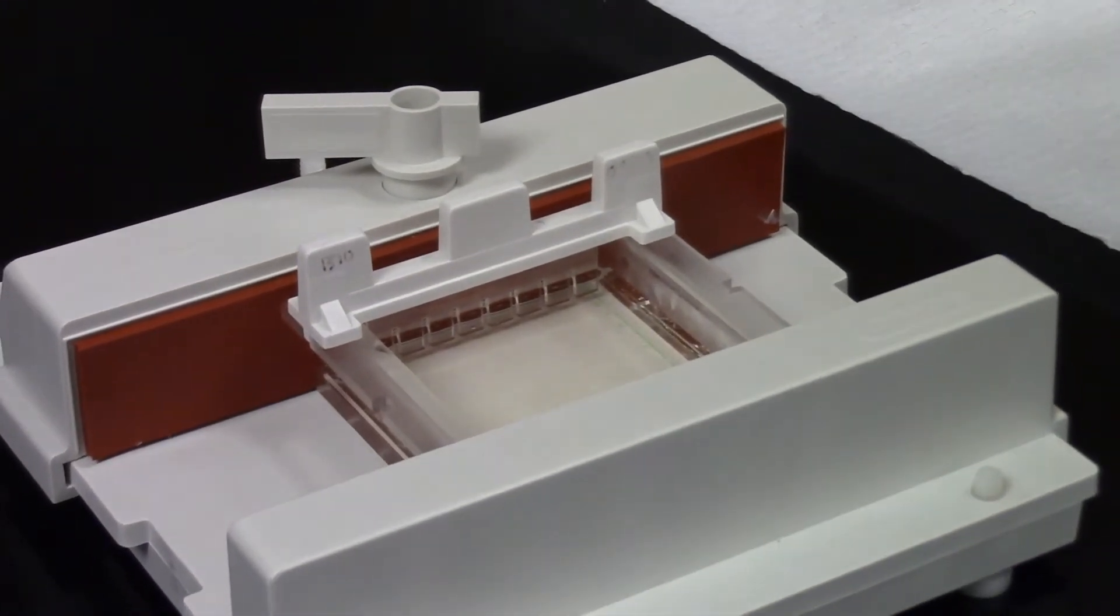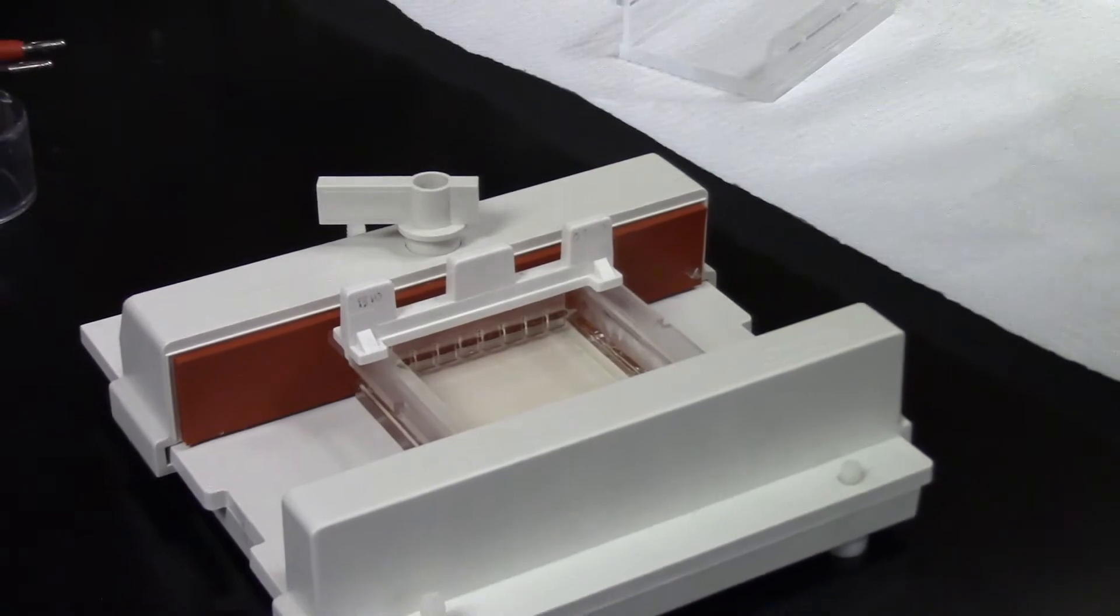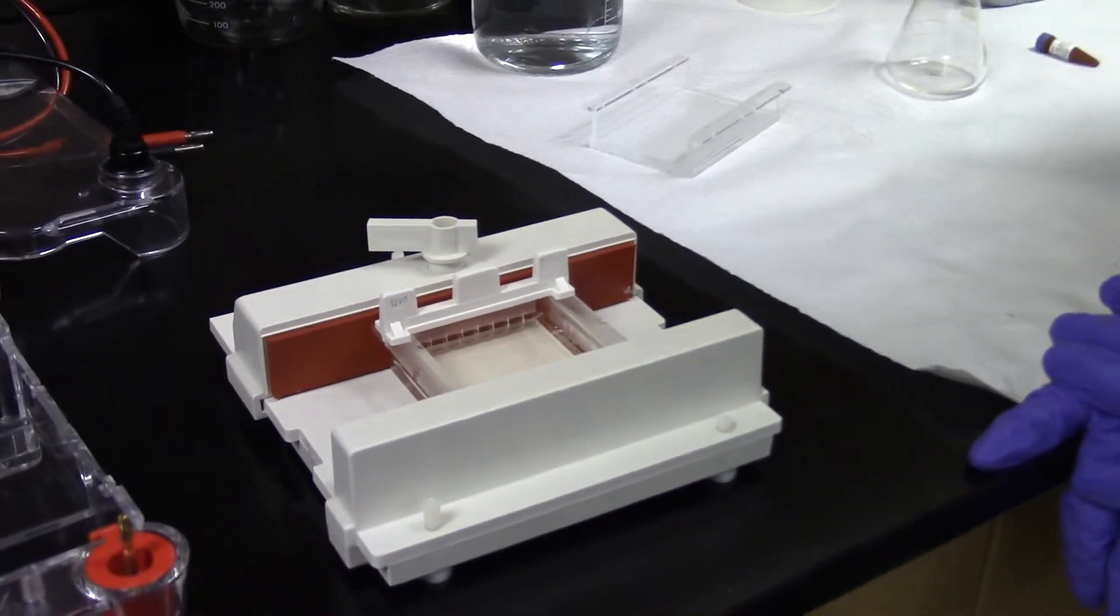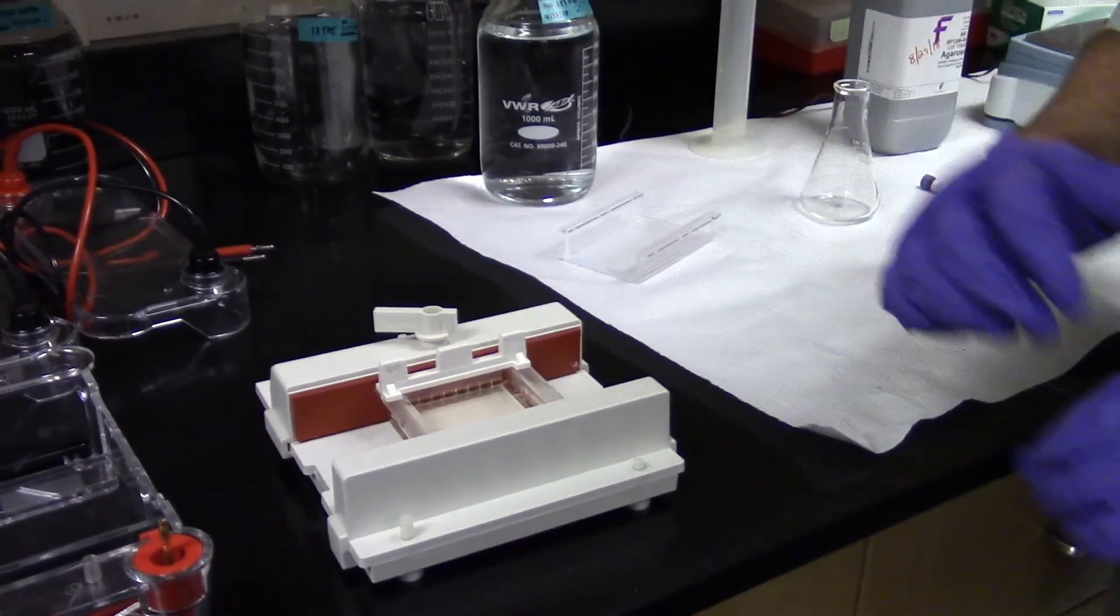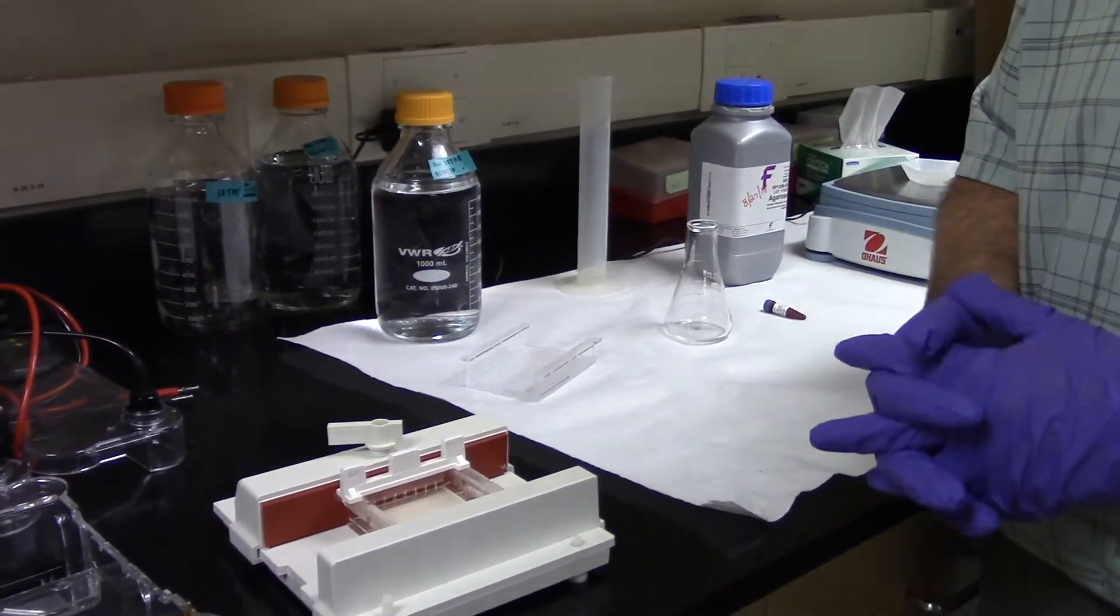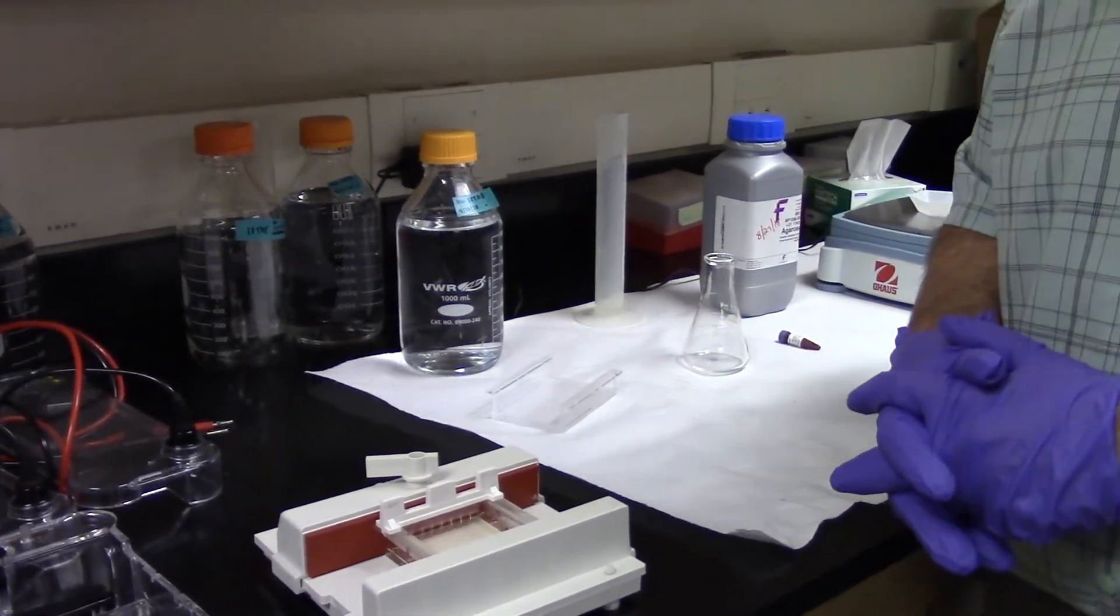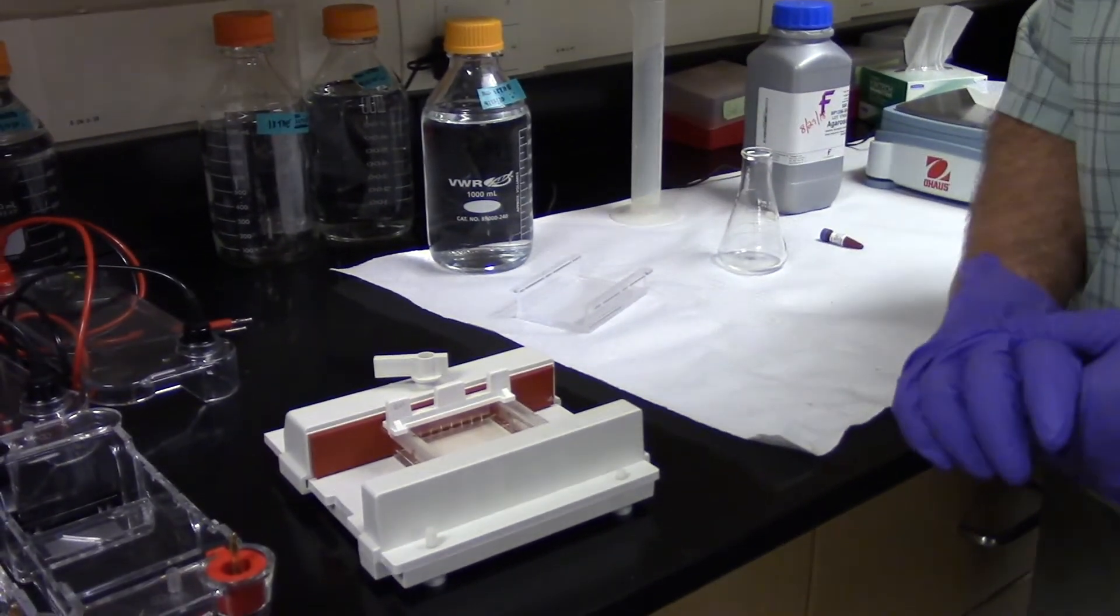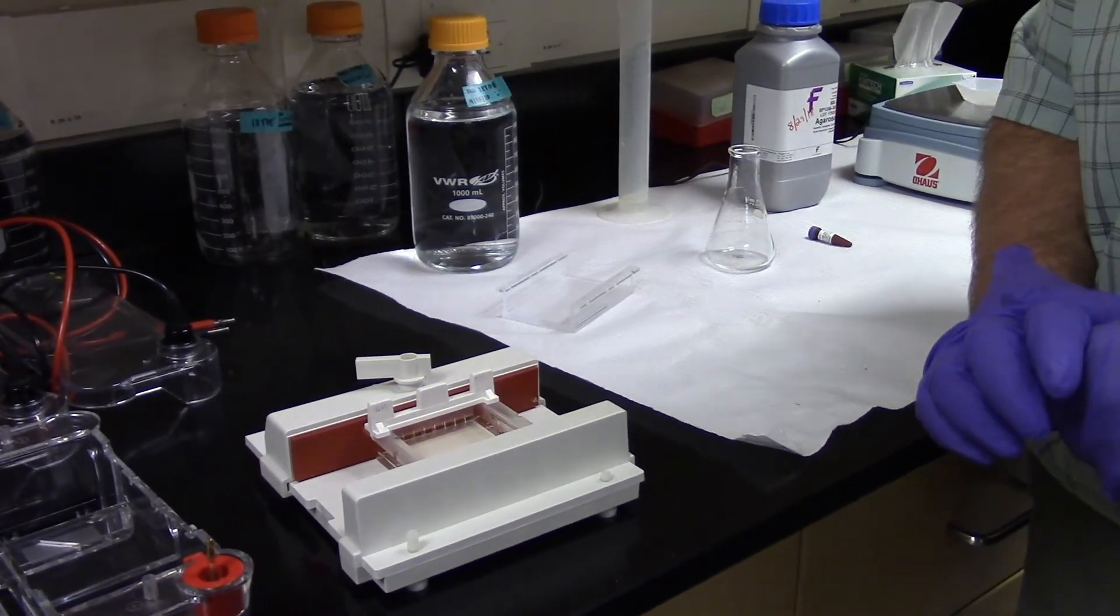I will then take our PCR product that we just finished up on the PCR machine and add those to each of these wells. And then we'll be able to separate those DNA fragments by length by moving them through the matrix of the agarose.